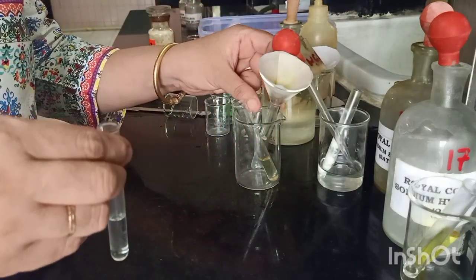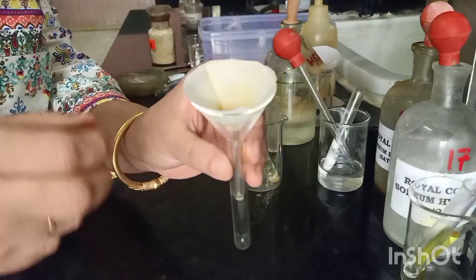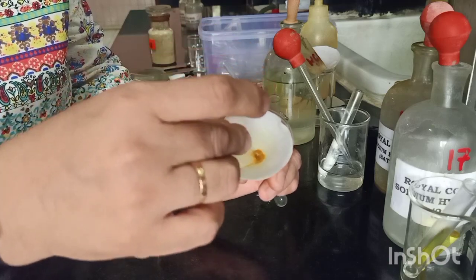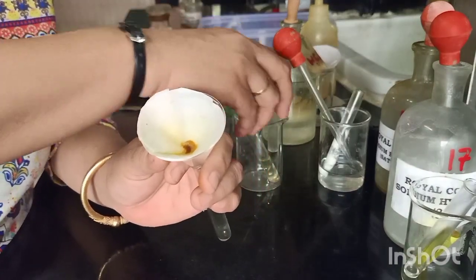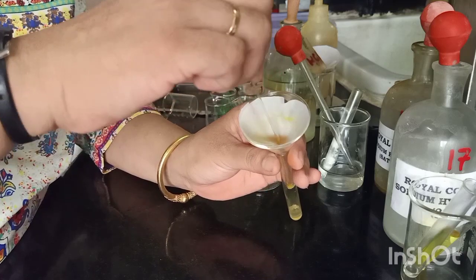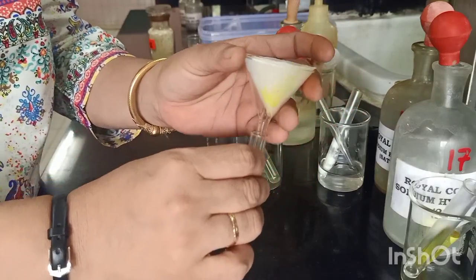We will again do the same thing — make a small hole with a capillary. Please take a sealed capillary, a fresh one for every test, so that there is no contamination. And now we will add our 1:1 HCl. As you can see, the residue is all coming down — it just flows down with the reagent. We will shake it very properly and check for re-precipitation.